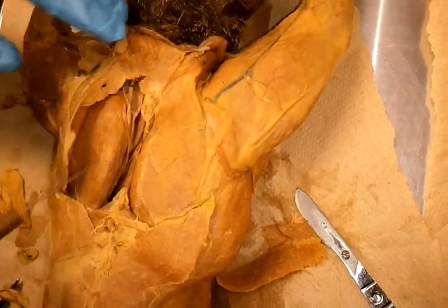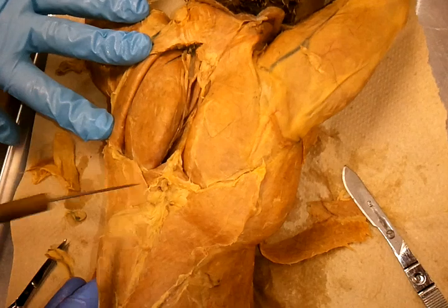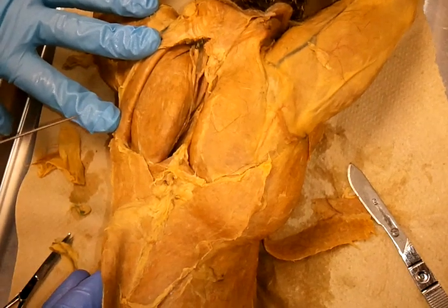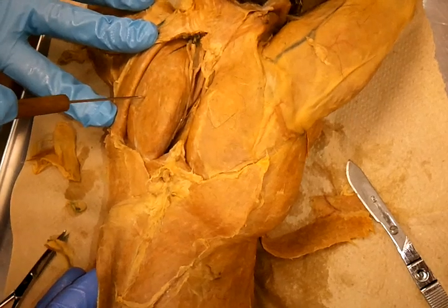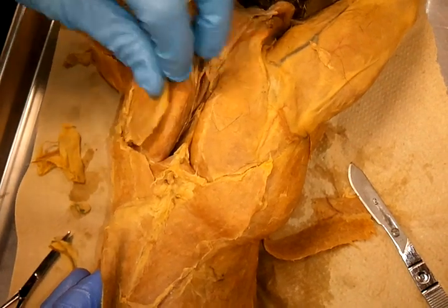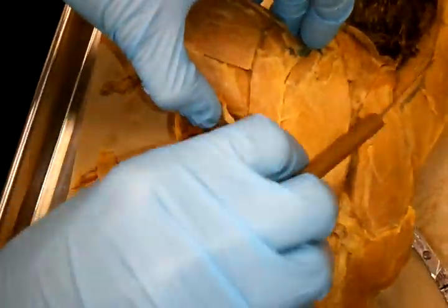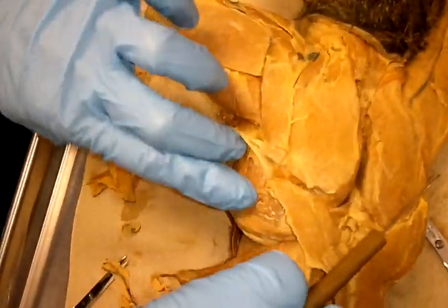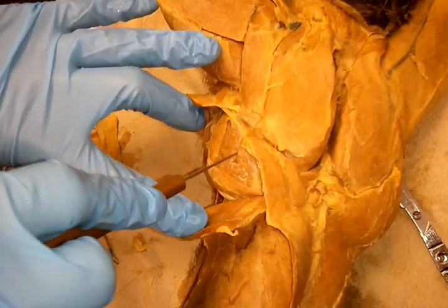As you reflect this muscle, you're going to have your scapula covered with more muscles. So this one on top is your supraspinatus. And if we look at it from the inferior side, then this one is infraspinatus.